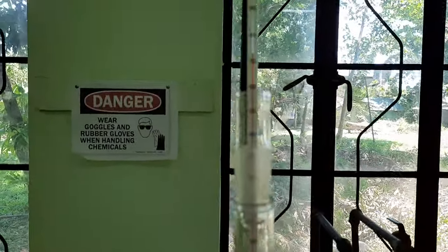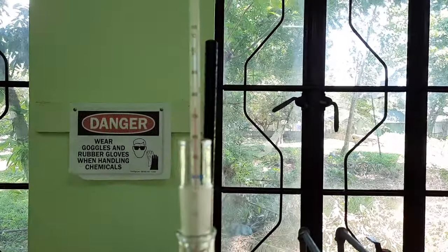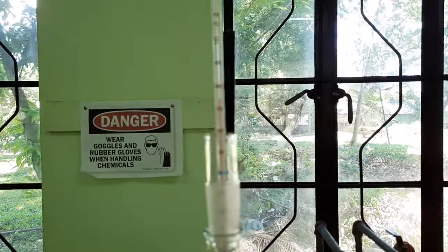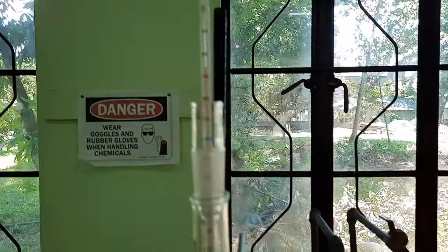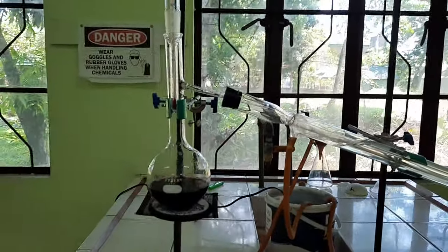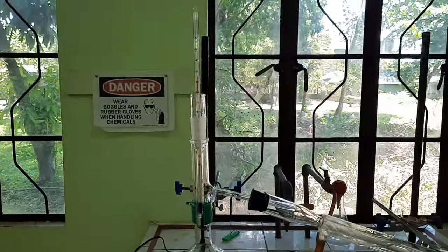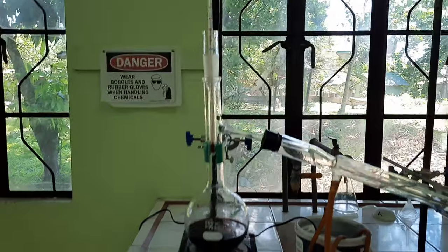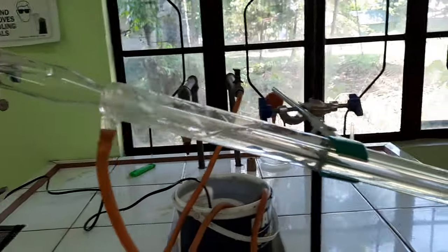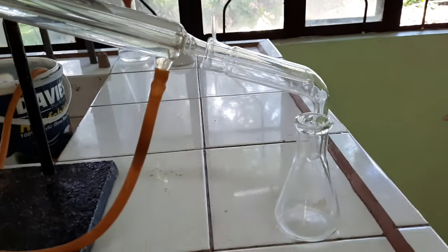Our temperature has now reached 75. This is most likely the temperature where alcohol is starting to evaporate. That is our current temperature here in our flask, indicating that alcohol at any time at this point might start to evaporate and condense into our condenser and eventually be distilled as our distillate here.